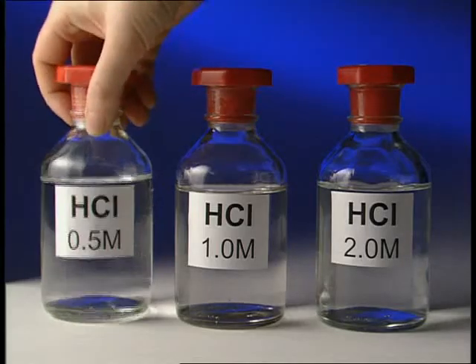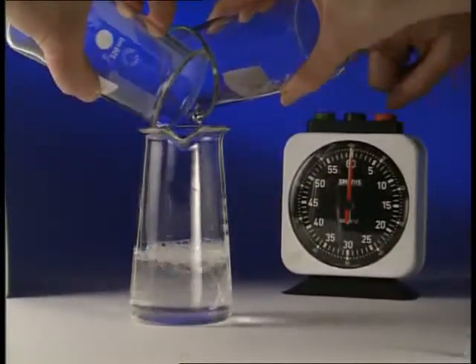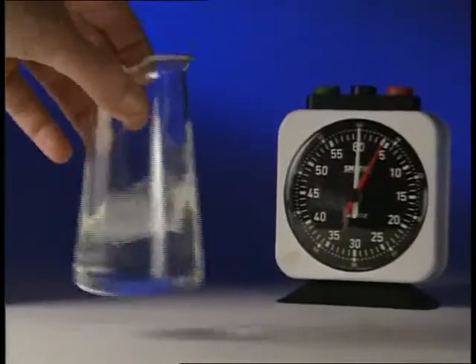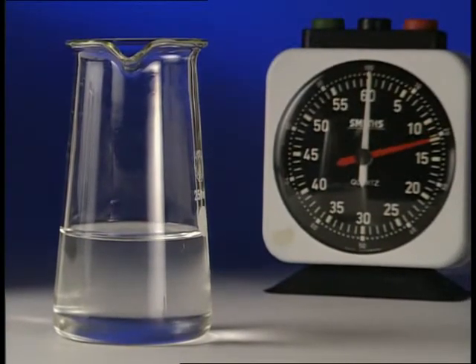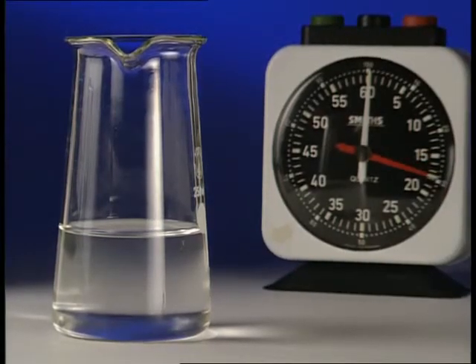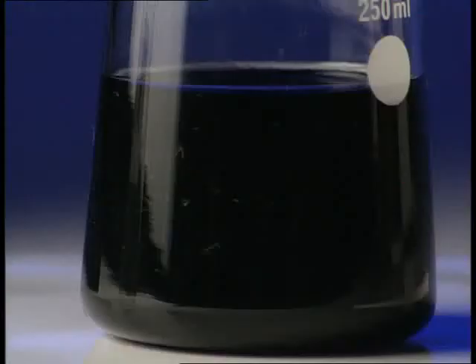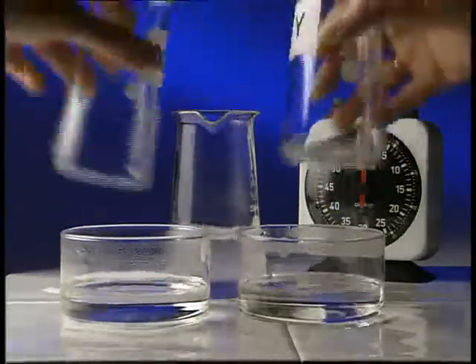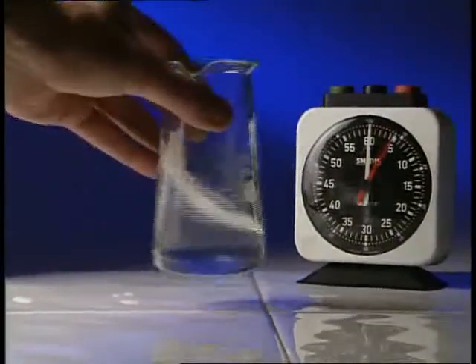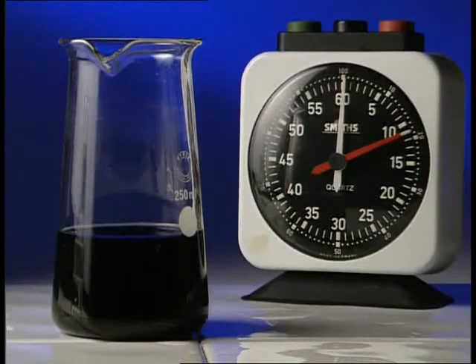Decrease the concentration of hydrochloric acid — what do you think will happen? With this reaction, the initial mixture is at a room temperature of 25 degrees C. It's colourless, but the moment that one of the reactants is used up, it changes suddenly to deep blue-black. It takes just 21 seconds. At 35 degrees C, the reactants are now 10 degrees warmer. This time, it takes just 11 seconds.